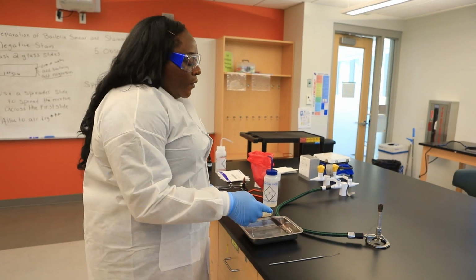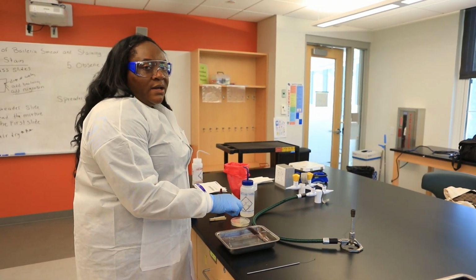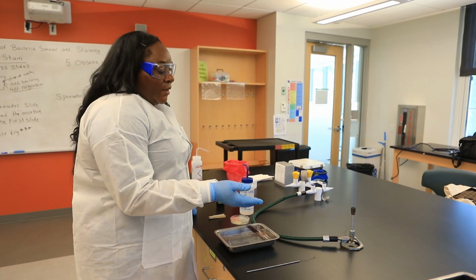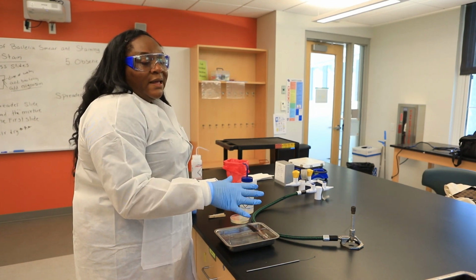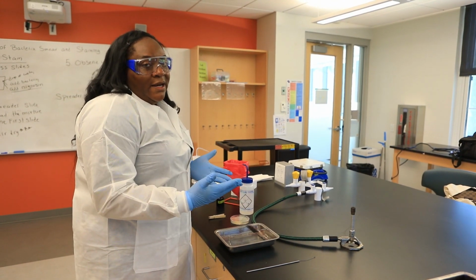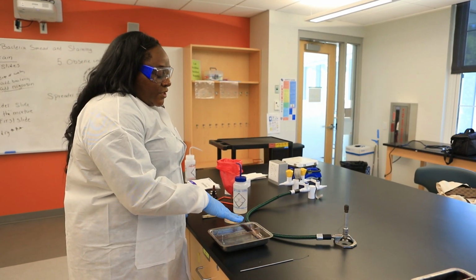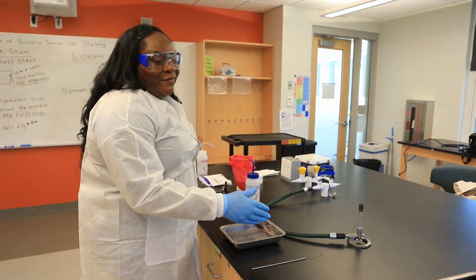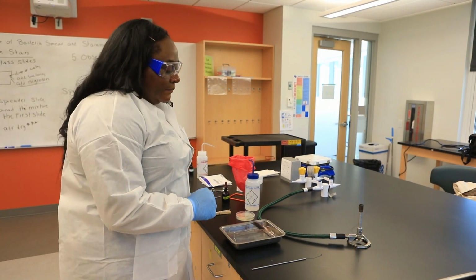You would not apply oil to the whole slide. You would just apply oil to a portion of the slide, and it would be a very, very small drop of oil, because remember, when the 100 times objective lens comes into contact with the oil, it's going to spread anyway. So you want to make sure that only to a small portion of this slide, you add a small droplet of the oil. You should not add oil to the whole slide. Okay? Thank you.